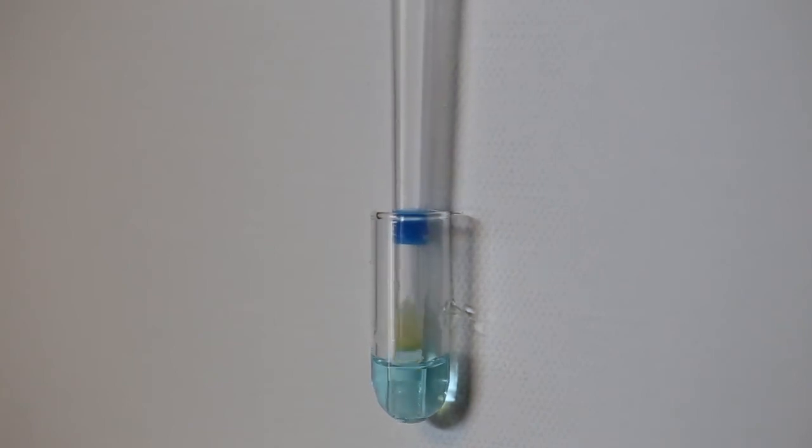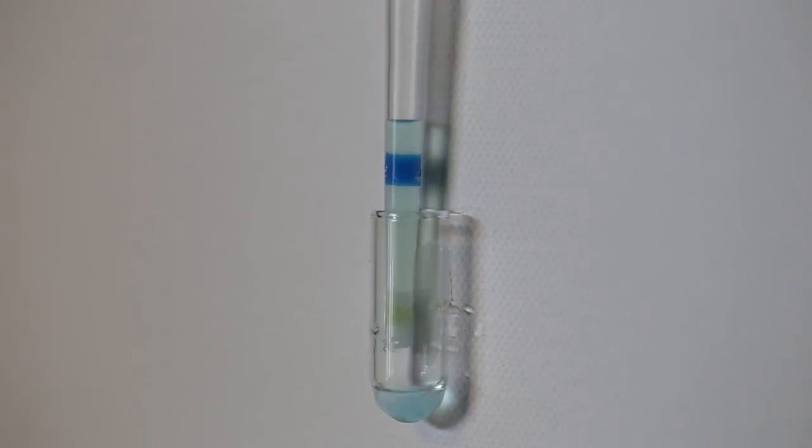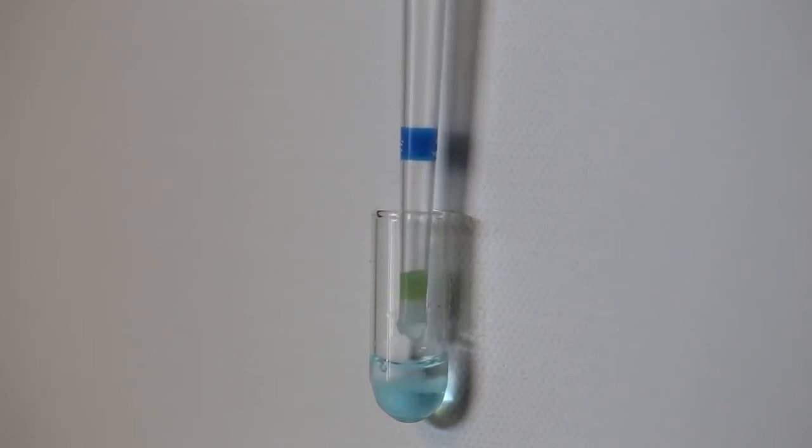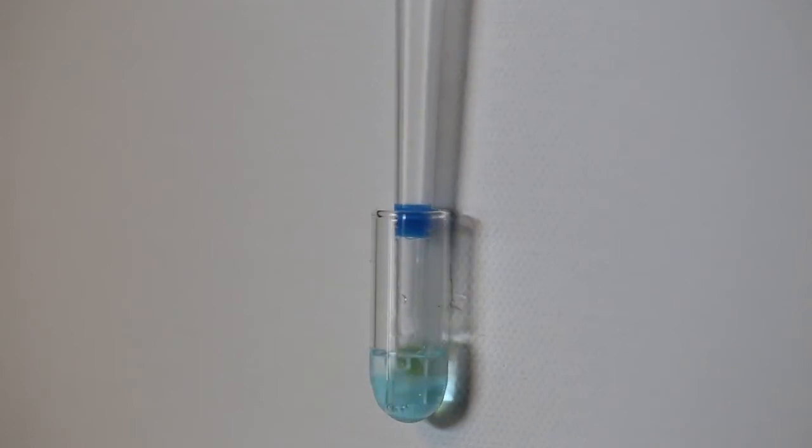Aspirate the sample solution in and out of the DPX wax S tip. The salt present in the DPX tip dissolves in the water and the acetonitrile separates from the water due to the increased ionic strength of the solution.